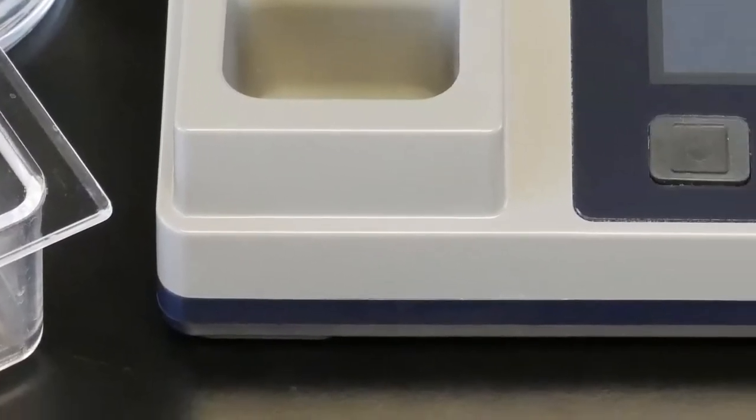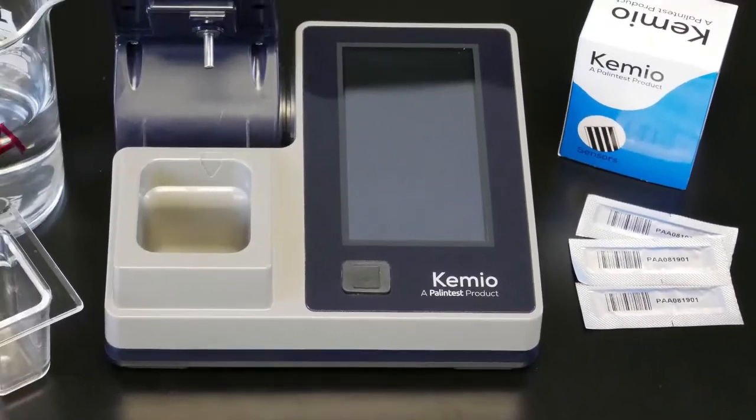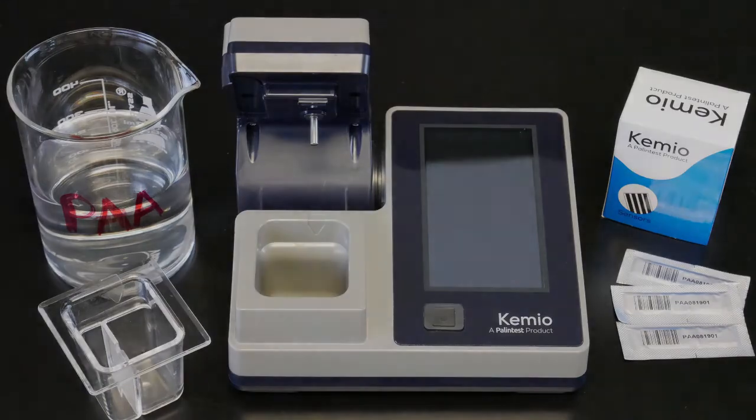For this test we need a Kemio disinfection unit, sensors designed for PAA, and the sample.